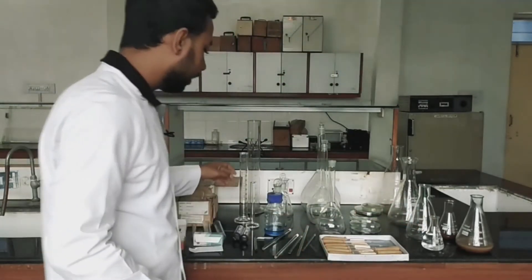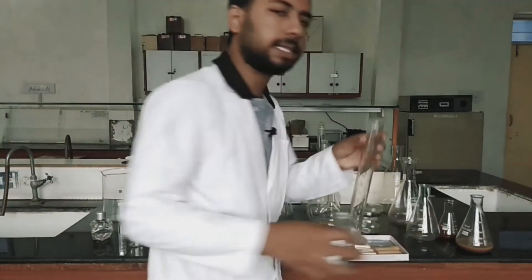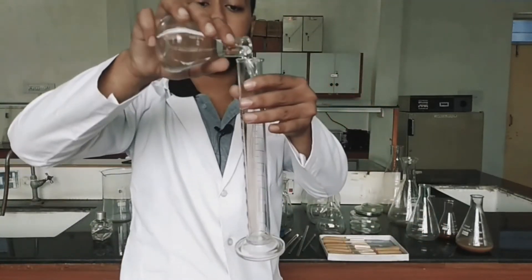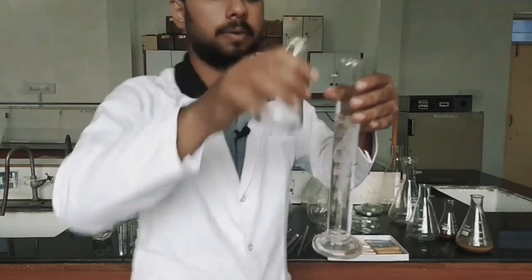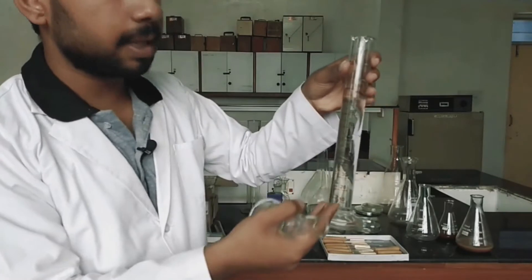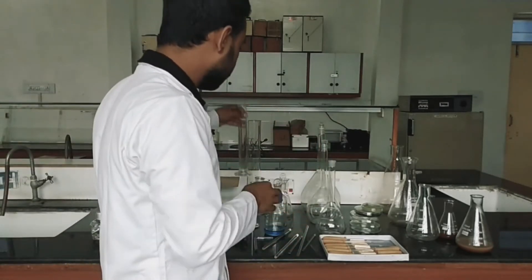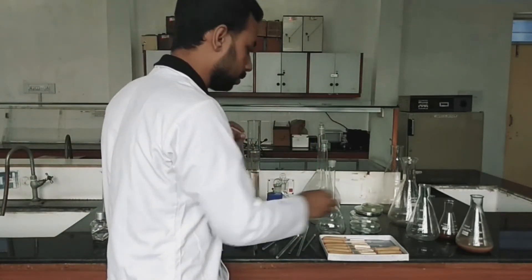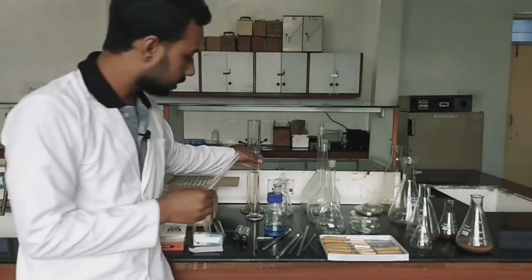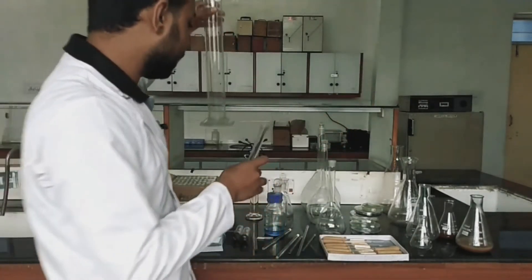Next is the measuring cylinder. If you want to measure a liquid, for example up to 94 or 95 ml or whatever level you need, you measure it with the help of this measuring cylinder. There are different varieties of measuring cylinders — this is 100 ml, this is 500 ml, and this is 10 ml. According to our use, we can select the appropriate one.